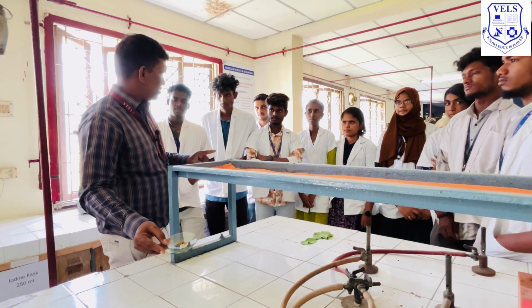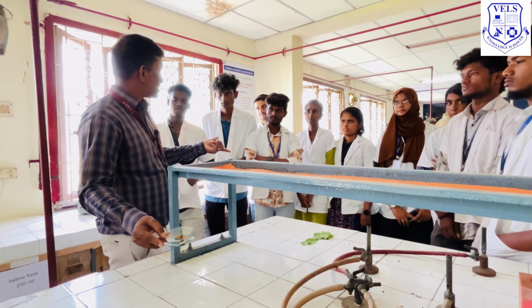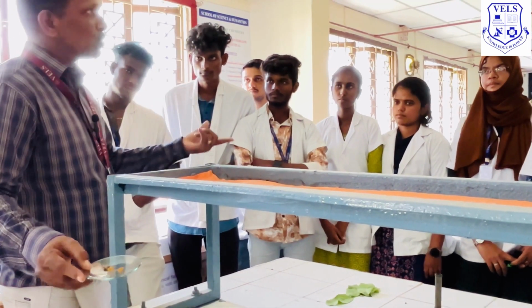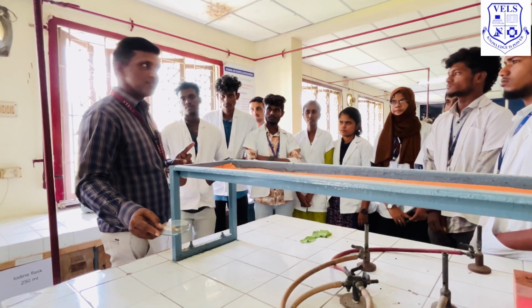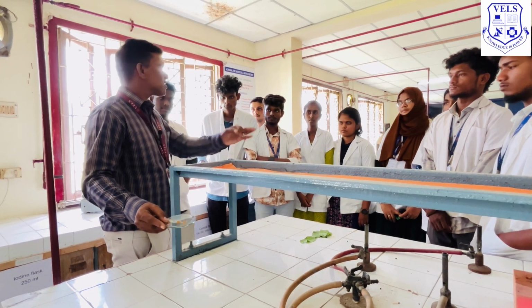So concentrate, add 6 ml of 30% acetic acid. You will get the crude hesperidin substance. You recrystallize using the acetic acid to get the crystals of hesperidin. Then dry it, take the weight, and note it down in the observation notebook.